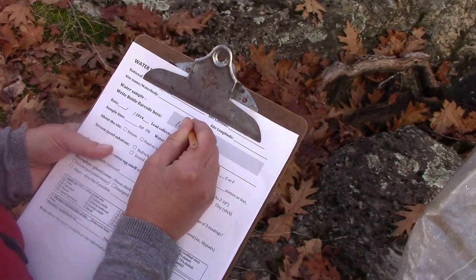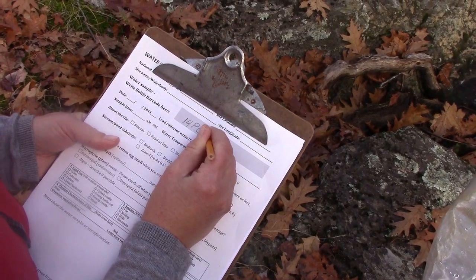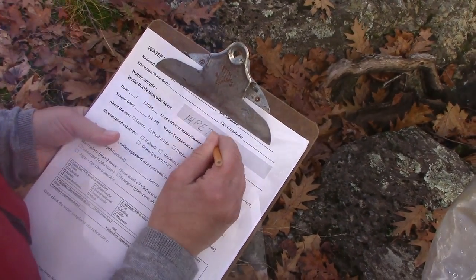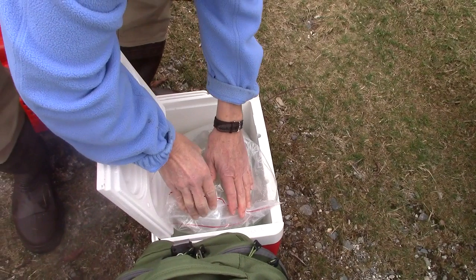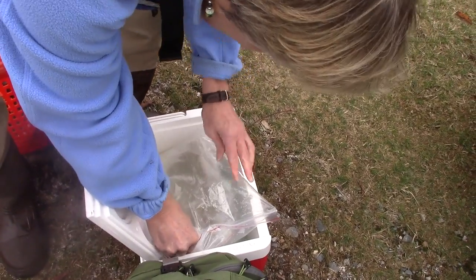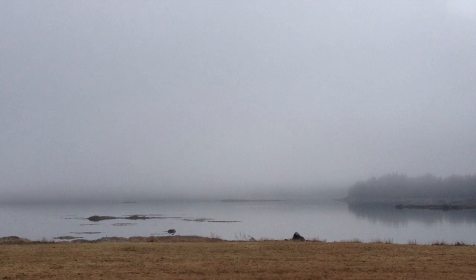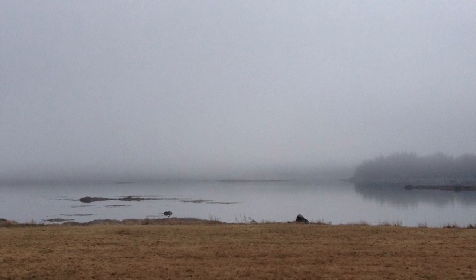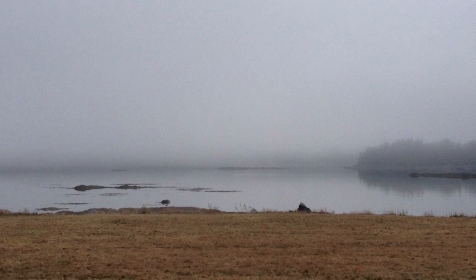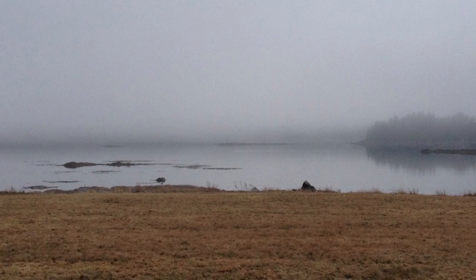Record the barcode that is on the bottle onto your field data sheet. If you have not done so yet, fill out the other information on the field data sheet. Place sample, sealed in its double bags, on ice in the cooler to store while in the field. Remember, leave no trace — be sure to collect all of your field gear and remove trash from the sample site before departing.